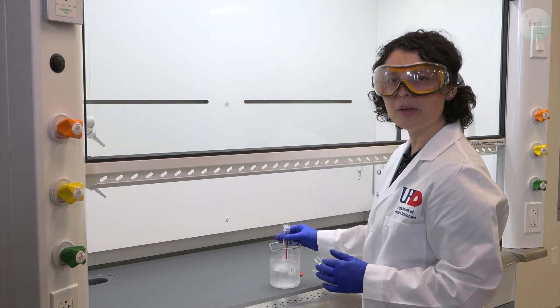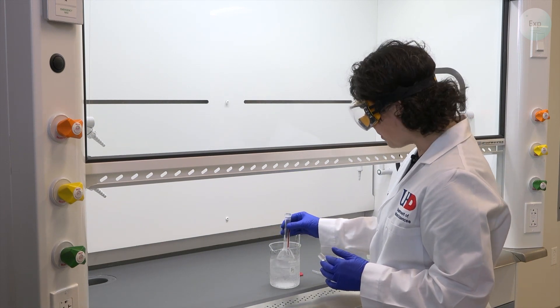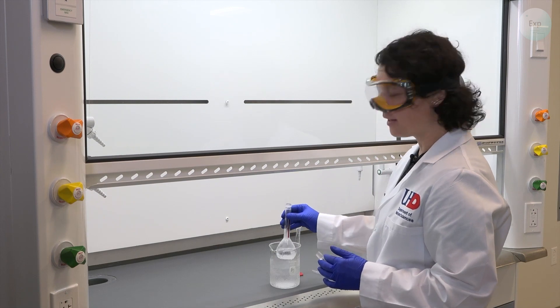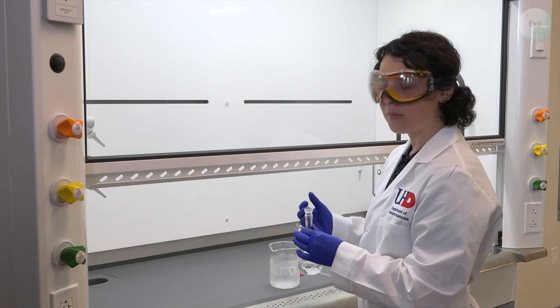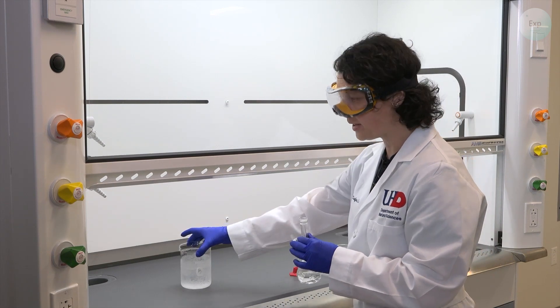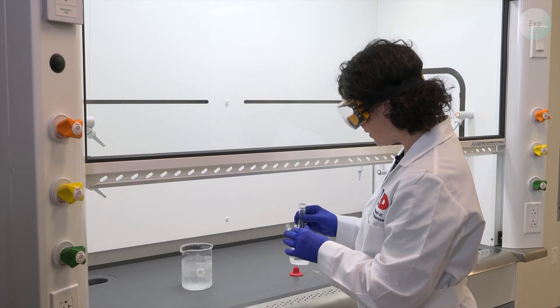The temperature of my volumetric flask is quite reasonable because I have been keeping it in the ice bath. Any additional additions of water will not change the temperature by much. So at this point, I can set my ice bath to the side.